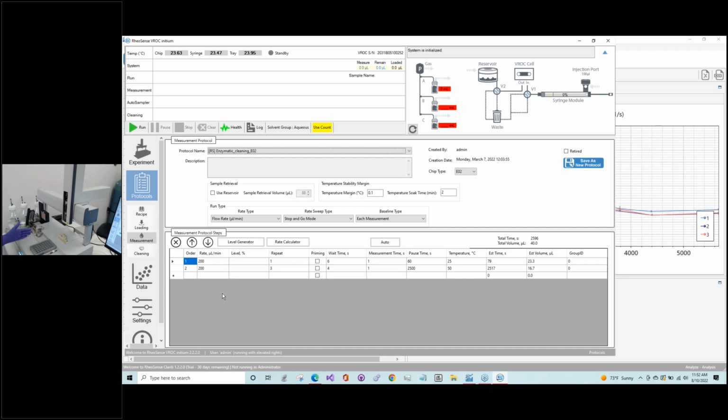And then this measurement protocol is going to pump a specific volume into the flow channel. Then it's going to elevate the temperature to 50 C. Then it's going to pause and soak that flow path for a period of time before pumping some fresh sample into it and soaking and holding it again. And then once that's finished, it will purge out.